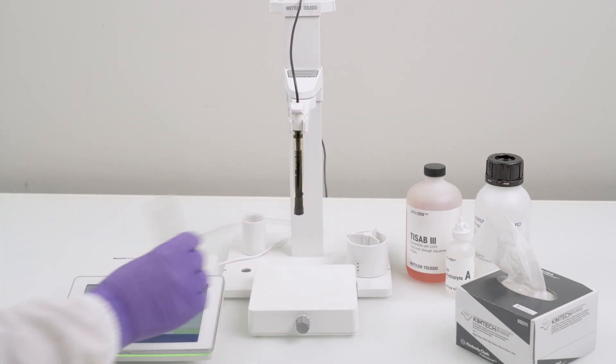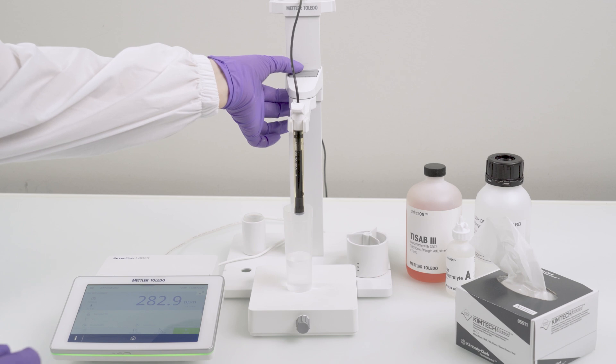For short-term storage, immerse it in a diluted ion solution without ISA.